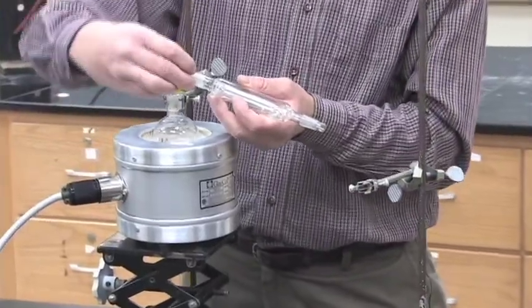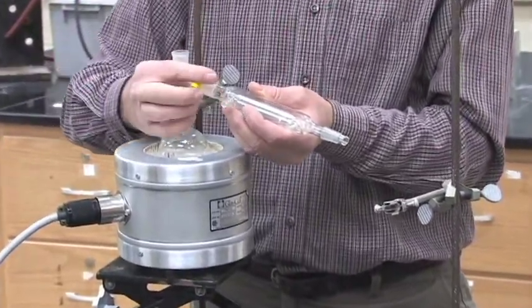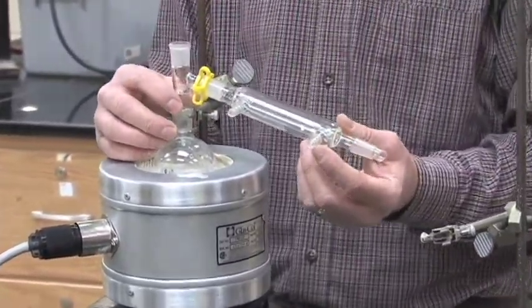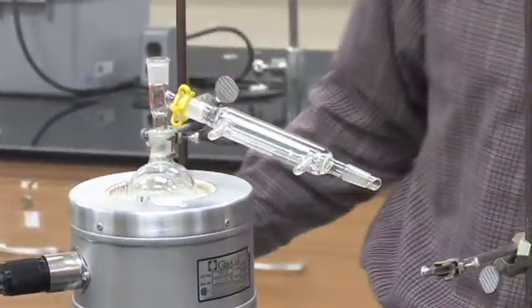So we don't need to put a Keck clamp on it, but the condenser gravity will not help us with so we need to make sure we use a Keck clamp to hold it in there.